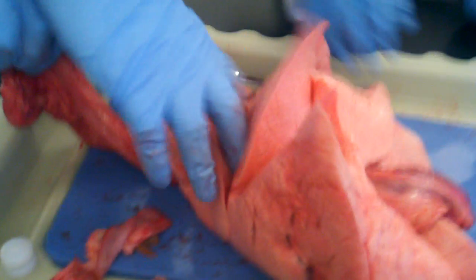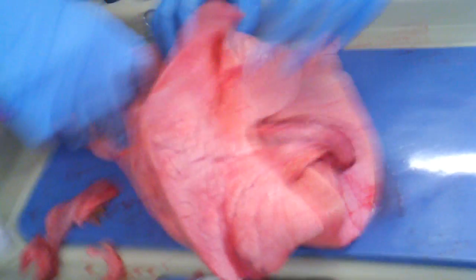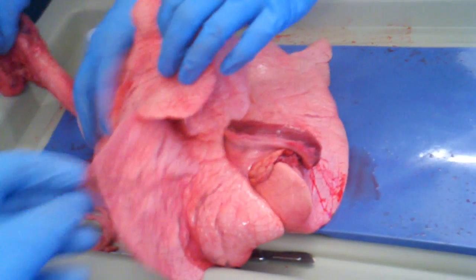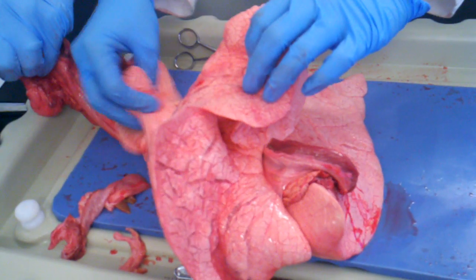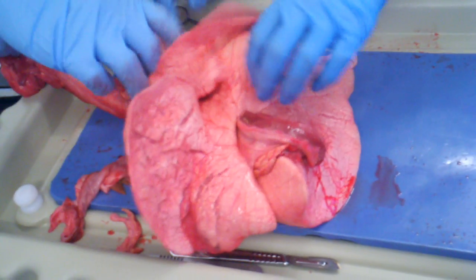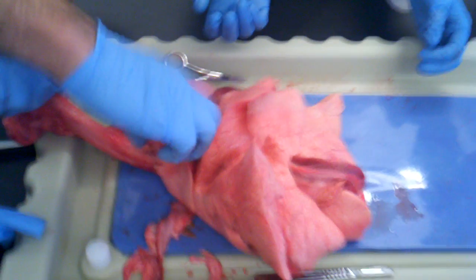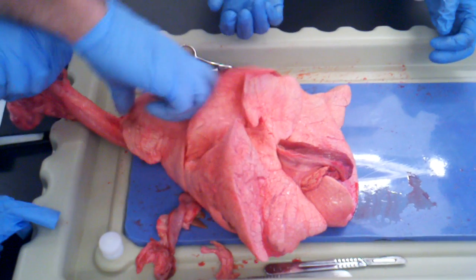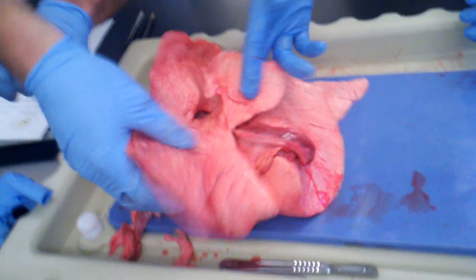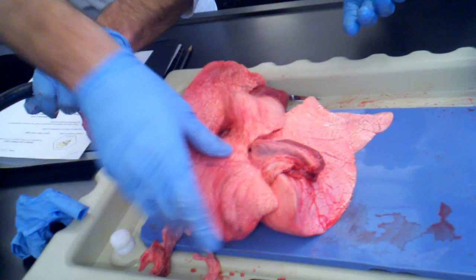We get to see the lobes really well. The lobes — it's not just one big massive thing, it's little different lobes and chambers. So would this be considered one lobe, the way it's kind of divided up? Like this is a lobe. Is this one? I think this is one lobe here. This is one lobe. I think this is all part of this lobe — this is just like a branch of that bubble.